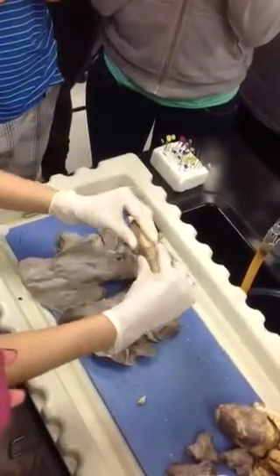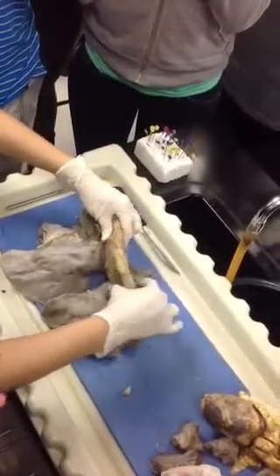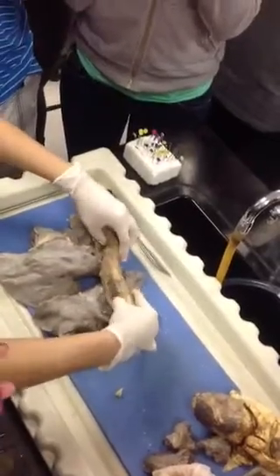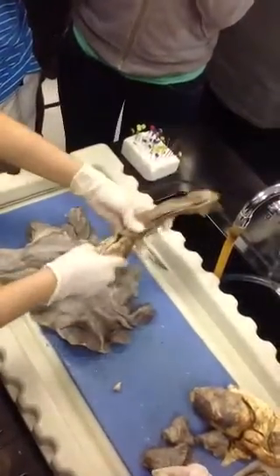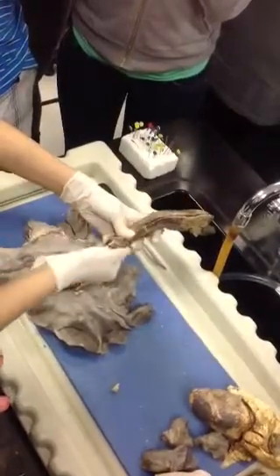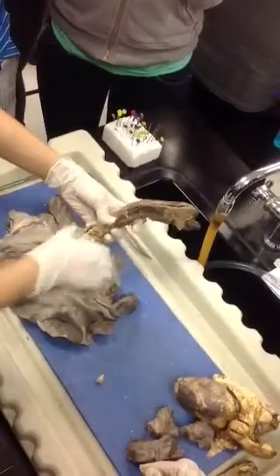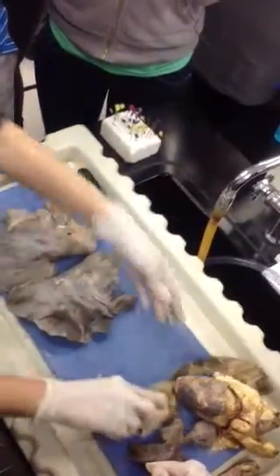Now on the outside, you can feel the hyaline cartilage because it's rough, and it acts as a protective layer for the trachea. All right, so we have it like this, and then eventually some of the bronchioles will jut into the lungs themselves. And then we have the primary bronchus.